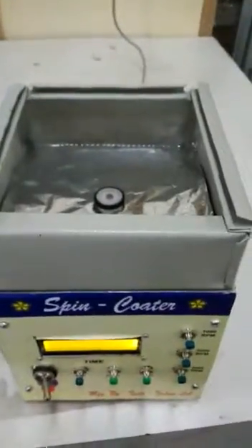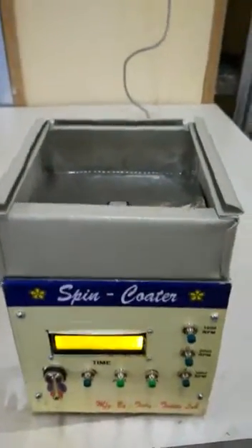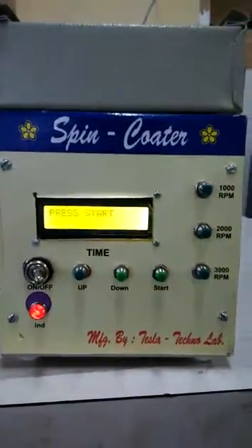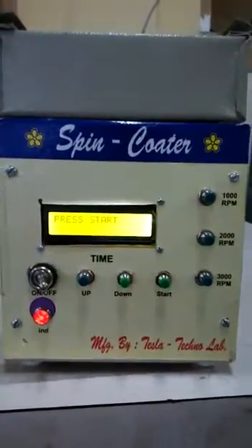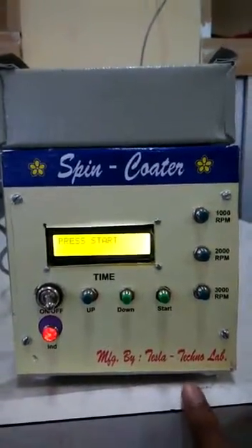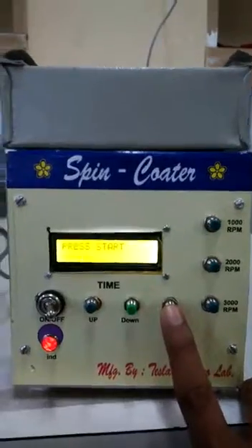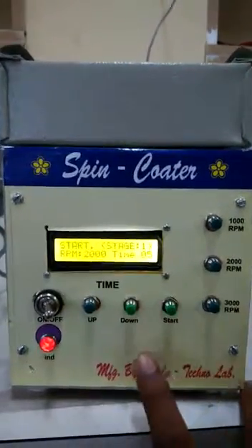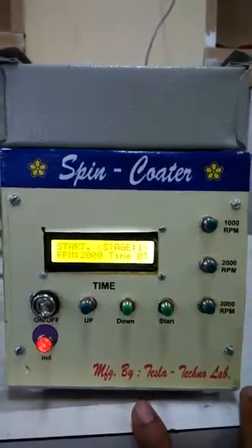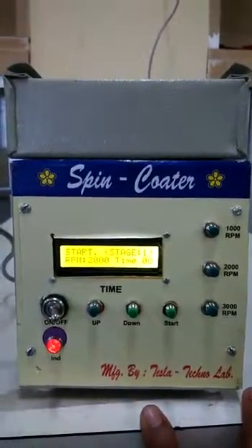Here is the top view of the system where the motor is running at full speed. For the next sample preparation, you do not need to re-enter the timing or RPM — just press the start button and it will run with the same settings. By this way you can take a number of samples.